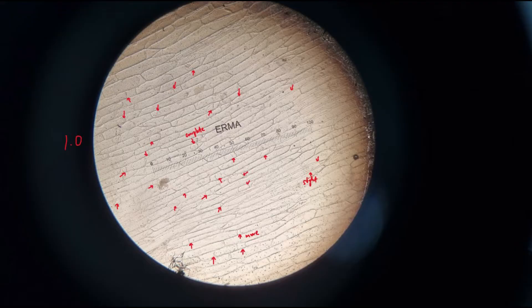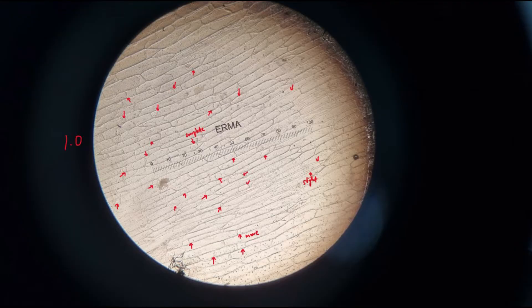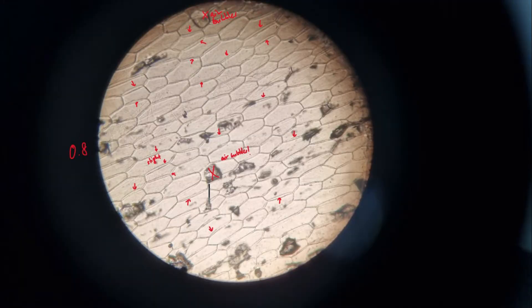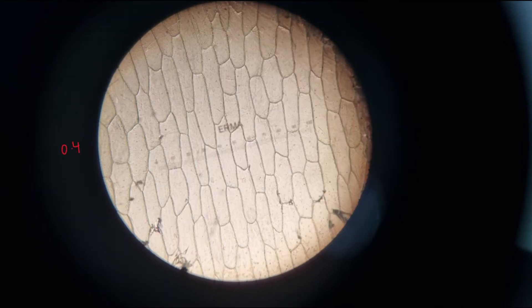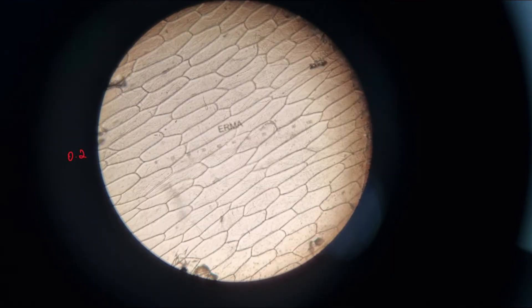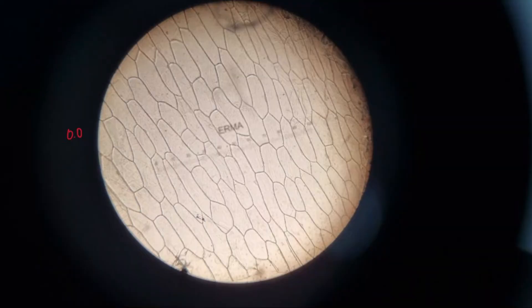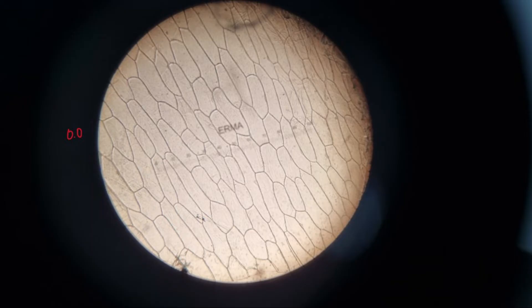As you can see, there are cells that are highly plasmolyzed and cells that are slightly plasmolyzed at 1 mol/dm³. At 0.8 there are still many slightly plasmolyzed cells. At 0.6 there are slightly fewer. At 0.4, however, it looks like there are none that are plasmolyzed — quite interesting. At 0.2, the same. And at 0.0, which is distilled water, there are no plasmolyzed cells at all.